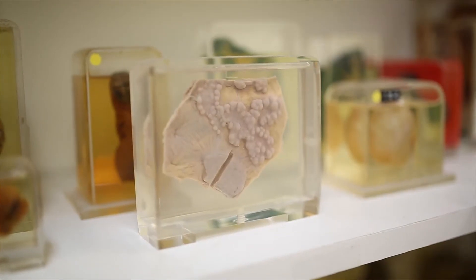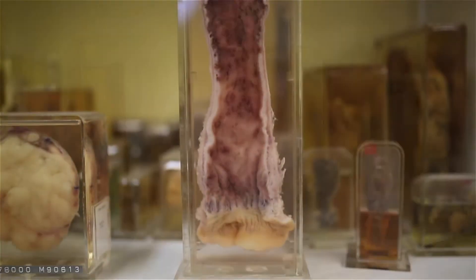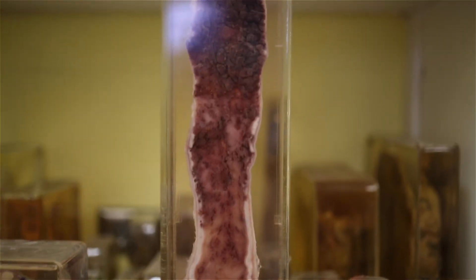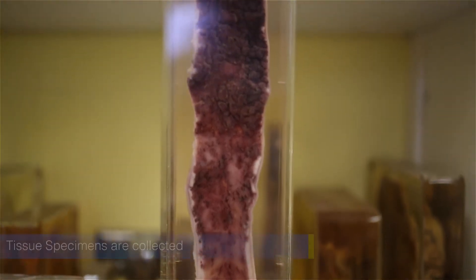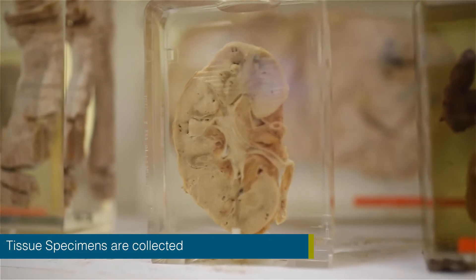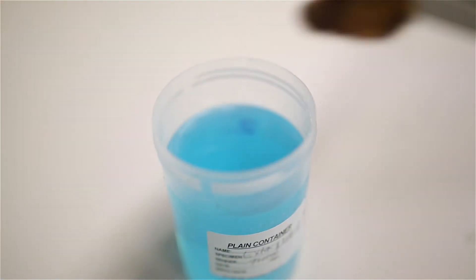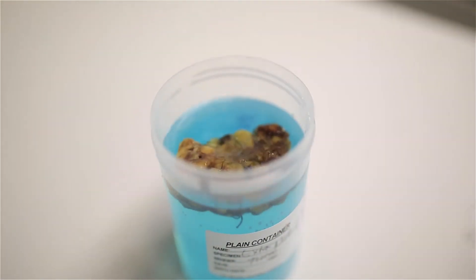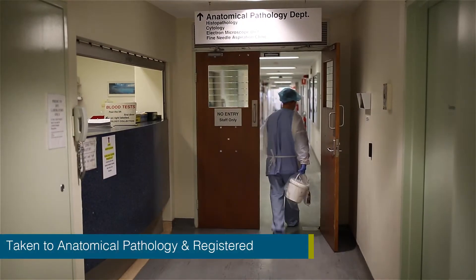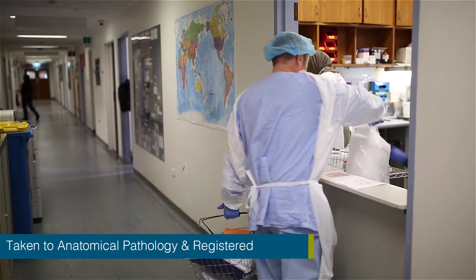Tissue samples obtained from patients for diagnosis are handled and processed by an anatomical pathology laboratory. The samples are first obtained from a patient through a surgical procedure and are placed in a specimen jar containing 10% buffered formalin. The specimen is then transported to the anatomical pathology department for processing.